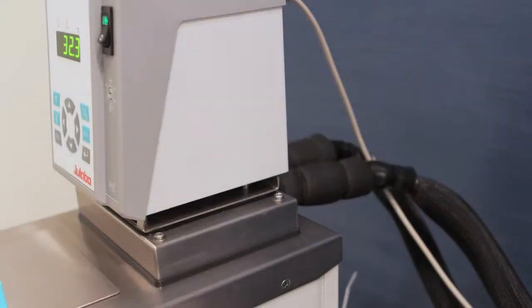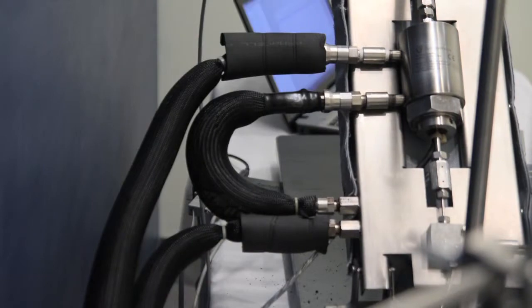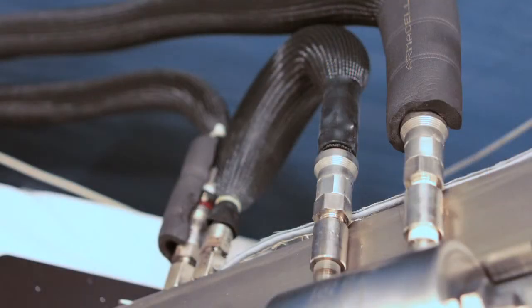The recirculating bath adapts to the PVT through thermally insulated hoses. The hoses are fitted with a quick disconnect for easy installation.